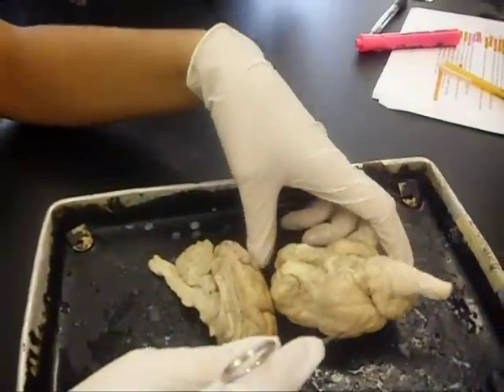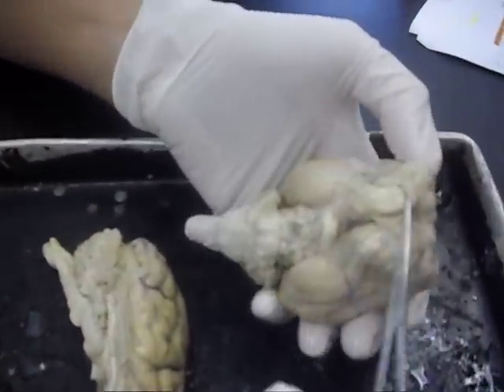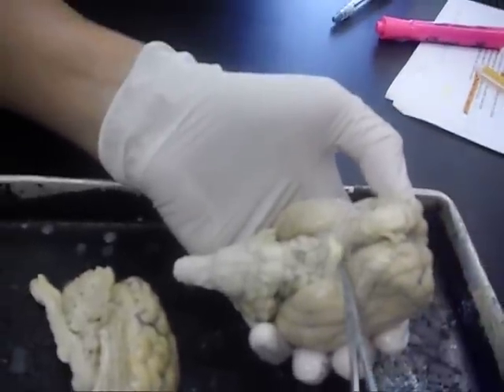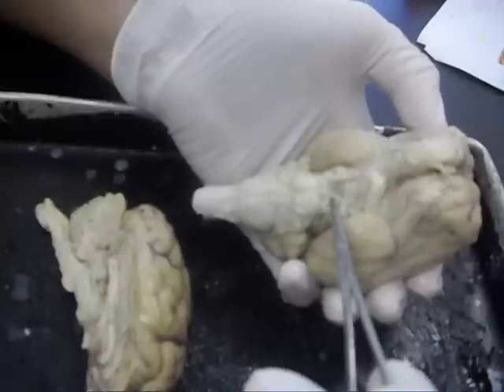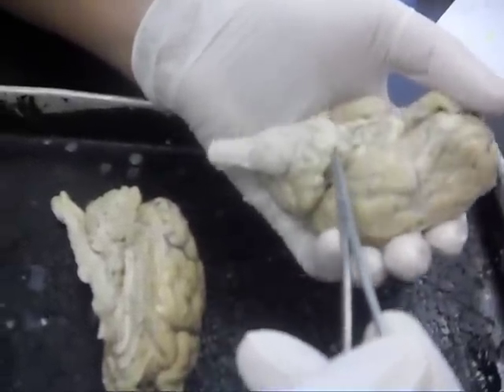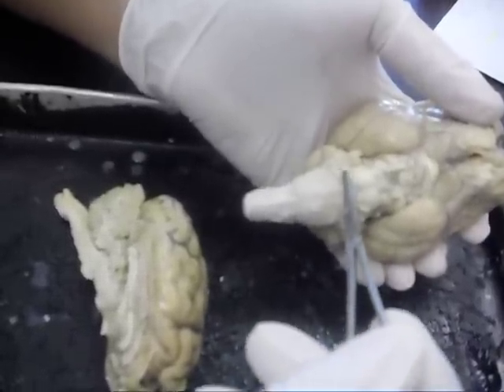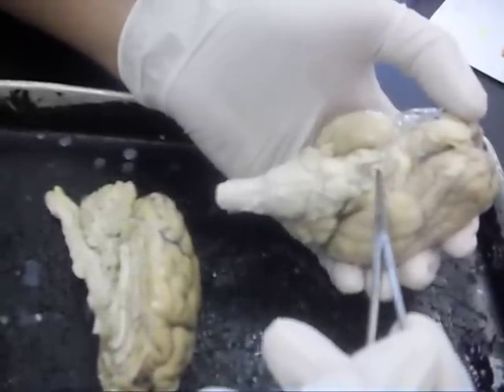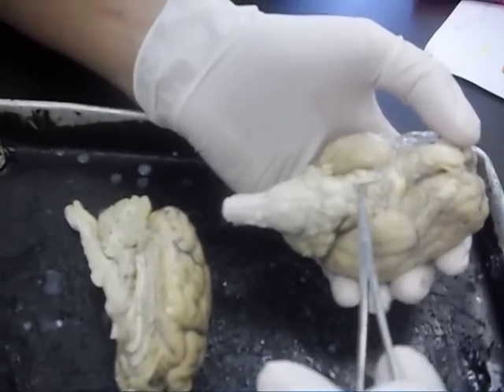What about the nerves? One, two, six — I don't have all the nerves, but that's nerve one, two, three — they're on both sides. Four is this little, little guy. Five is the stump. What's the mammillary body? The mammillary body is this. And that's the infundibulum, like we said. And what hangs from the infundibulum? The pituitary gland.